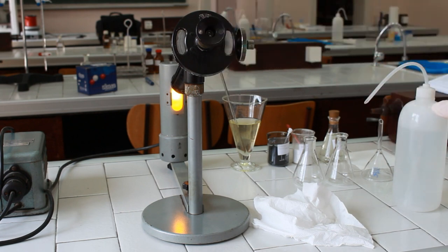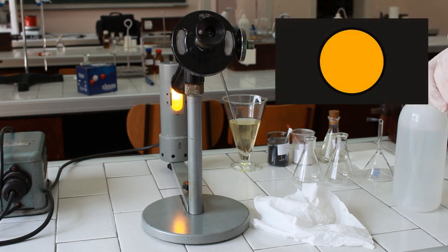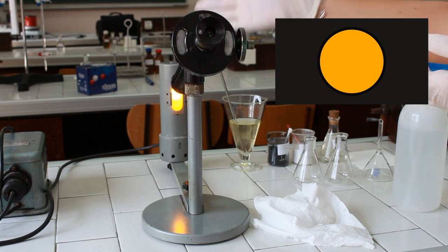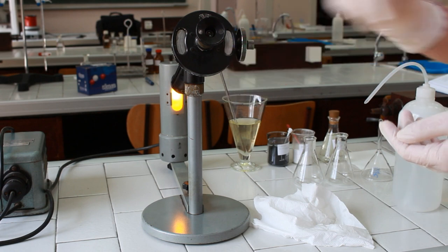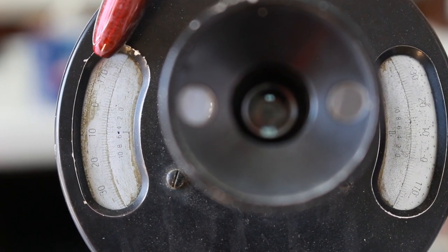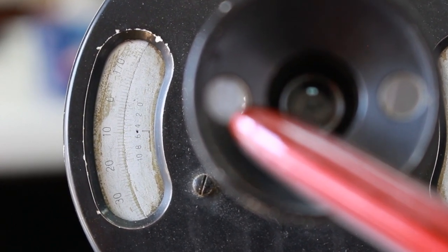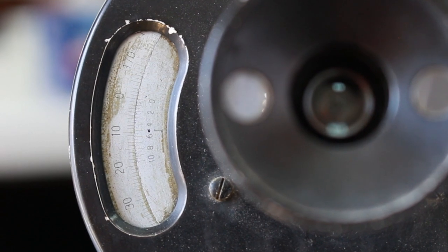Take a look — what should be noticed is a homogenous yellow circle. That indicates that the angle of rotation is zero, which can be read on the scale. Take a look at the polarimeter and notice the homogenous yellow field, indicating that the non-optically active substance is placed in the polarimetric tube. Now we have to check the angle, which should be zero. If you cannot notice the scale properly, you may use the magnifying glasses on both sides of the polarimeter.